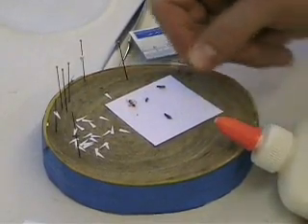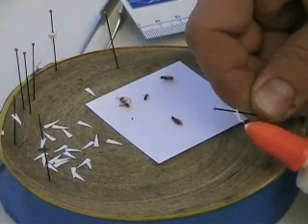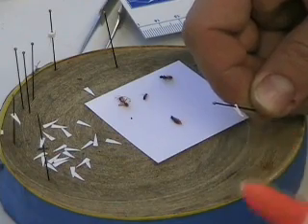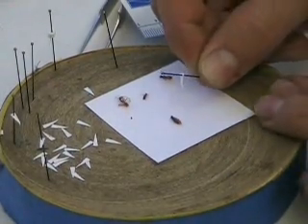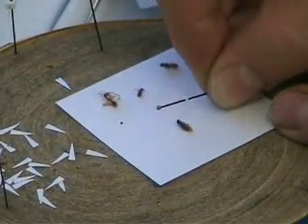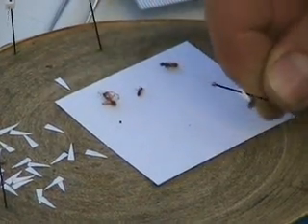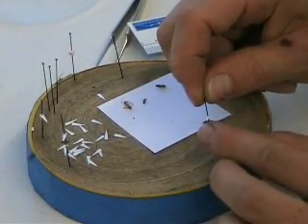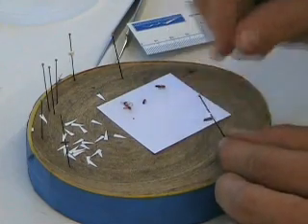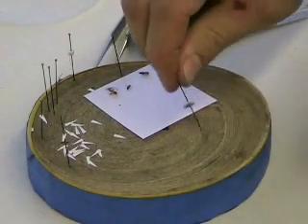Here's another specimen I'm going to point. I'm going to take glue and stick it right at the tip of that point. With larger specimens, you may need a little bit more glue. The specimen is on its left side with the right side sticking up. I stick the glue right on the right side of the thorax. Then I can manipulate it so it stays on the point a little bit better, and give it a gentle blow. Now that specimen is dried on that point.